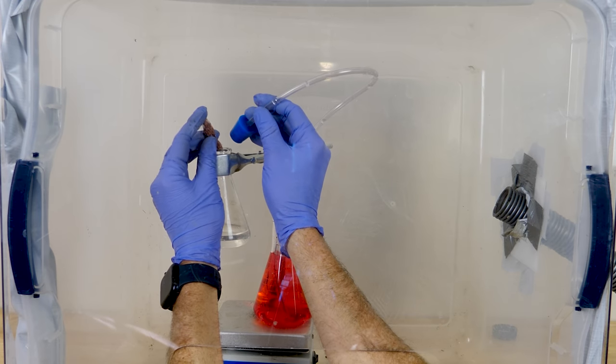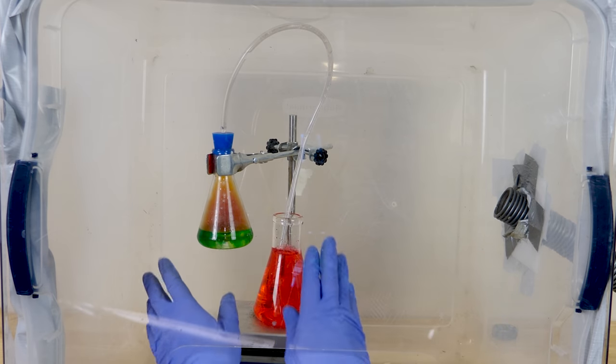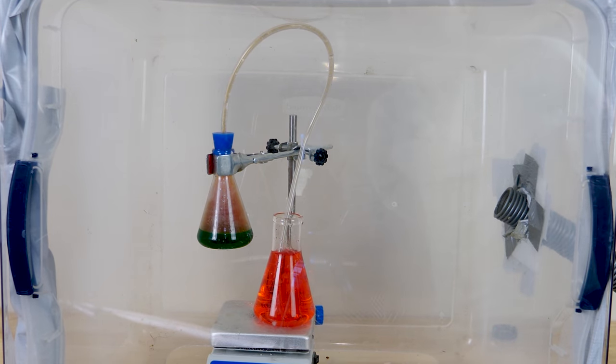Okay, put the copper in, then quickly put the cap on. So now the gas is bubbling out of the water. But then watch what happens. It's bubbling out, and then it kind of stops and reverses.